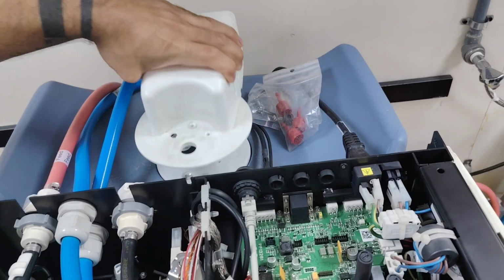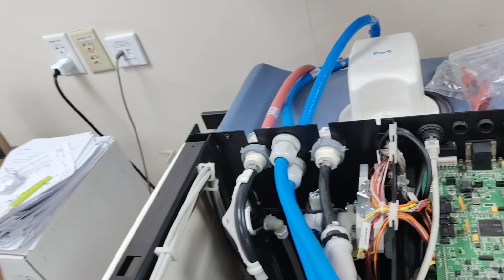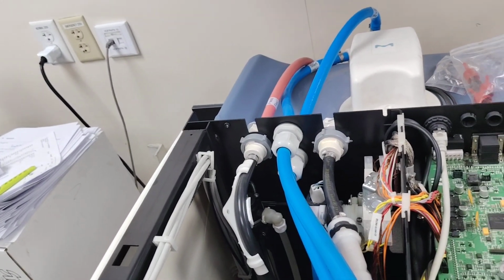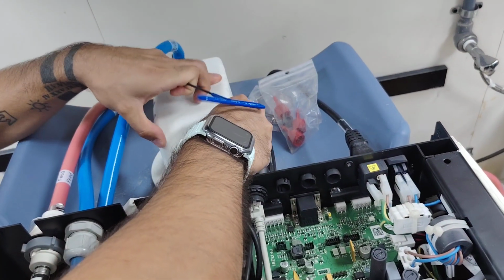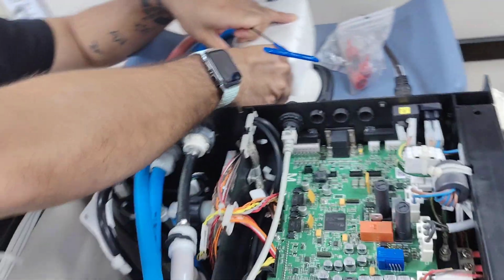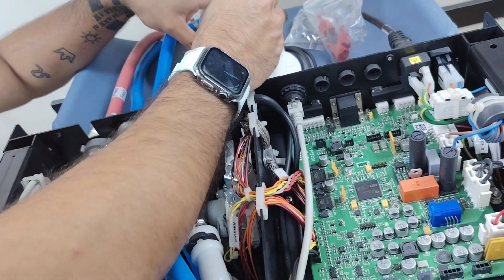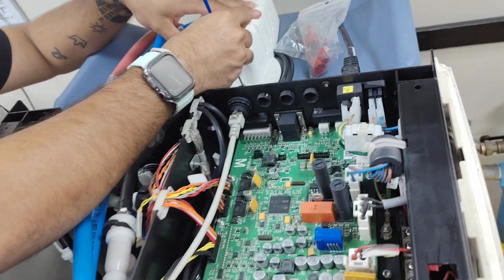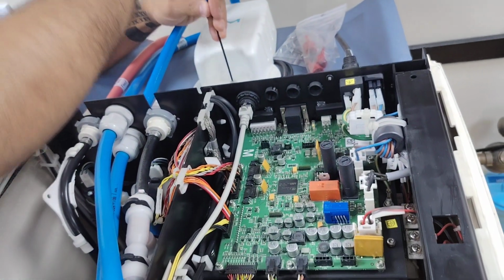It's all the same, no? No, they're not the same. These two are the same. This is different. The SM has a smaller, short one. So on that side is the short one. Yeah, only one short. They're easy to do. It's just if you need a 2.5. That's about it for this one.